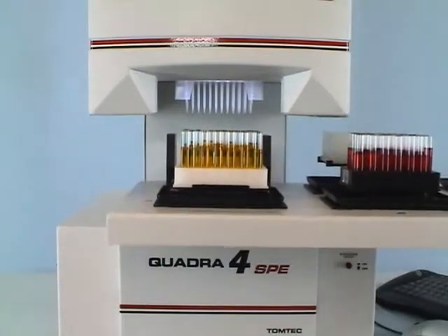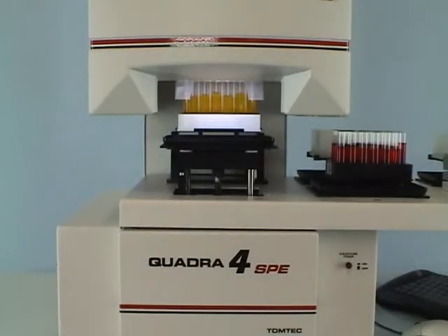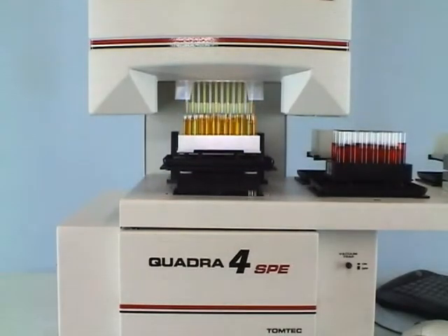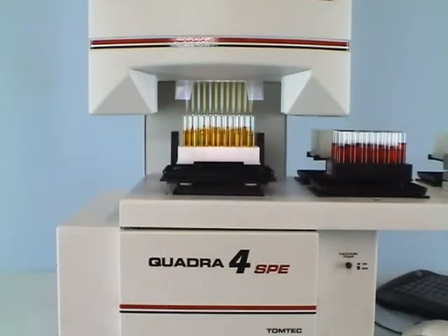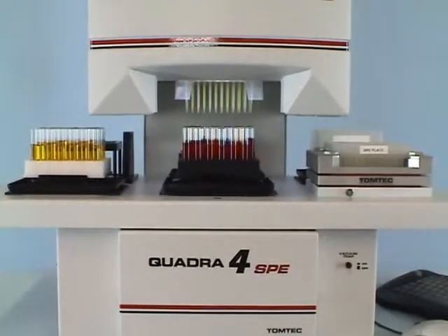If the volume to be transferred is less than 225 microliters, the Quadra program makes a single pass. Volume is aspirated from the 48 tips that serve the white rack, while the same volume of air is aspirated in the black tips. The Quadra shuttle moves to the black mirror rack.